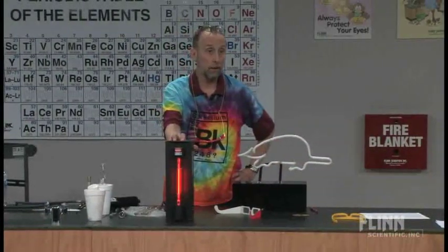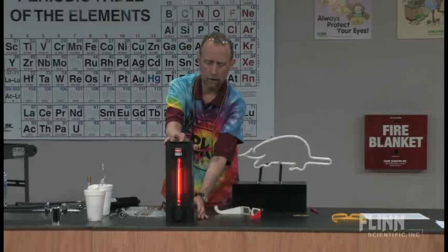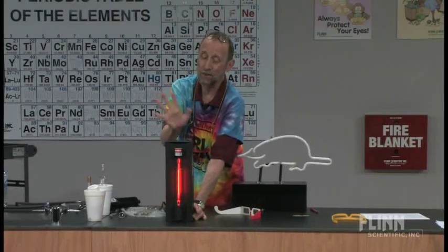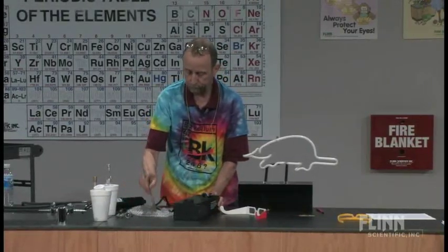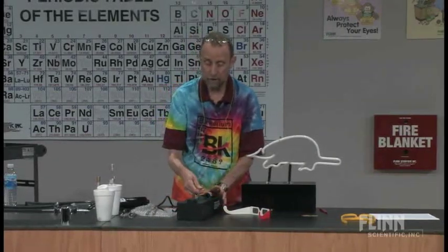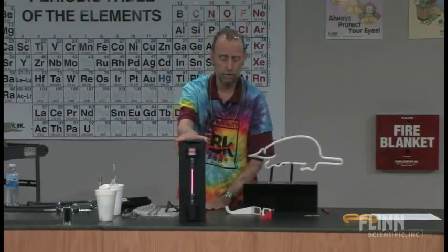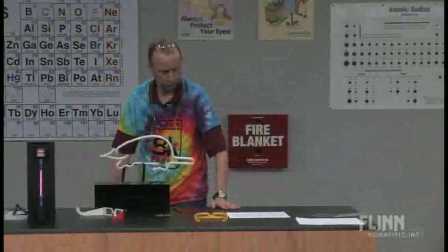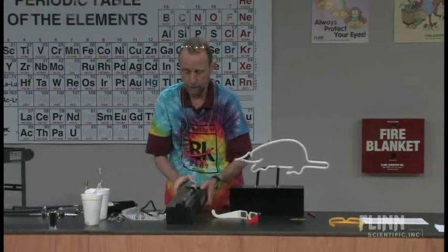I'd also have students look at white light from an incandescent light bulb — not a fluorescent bulb. Have them look at sunlight maybe coming through the window, but don't have them look directly at the sun — that's not a good thing. This next one is helium. This element was actually discovered on the sun before it was discovered on the earth, so it was named after the Greek god Helios. You get a nice set of lines there.